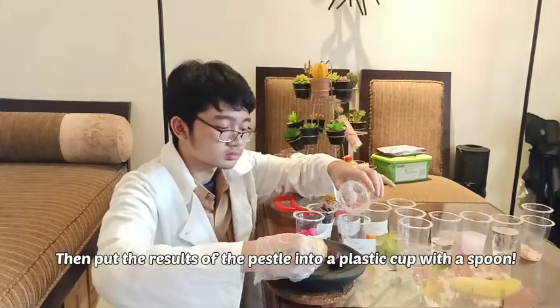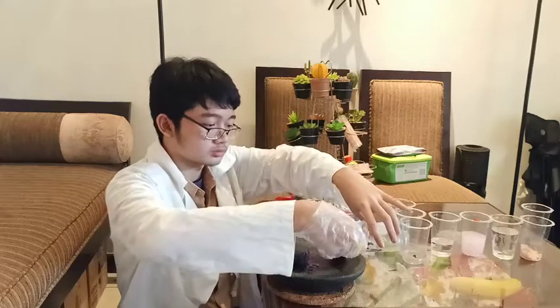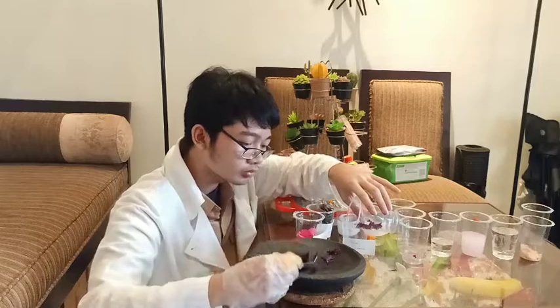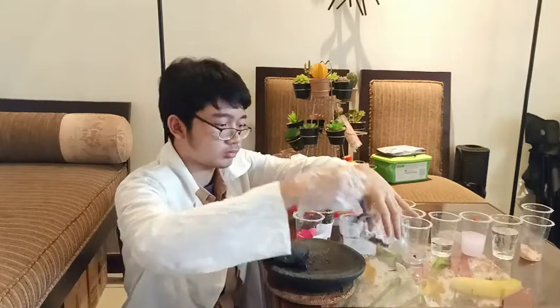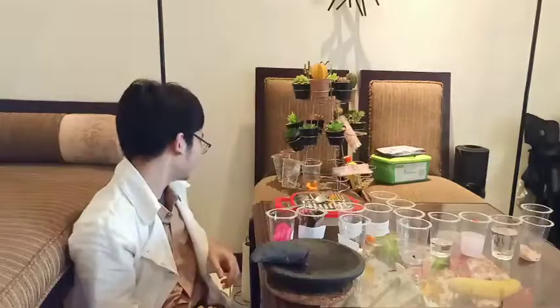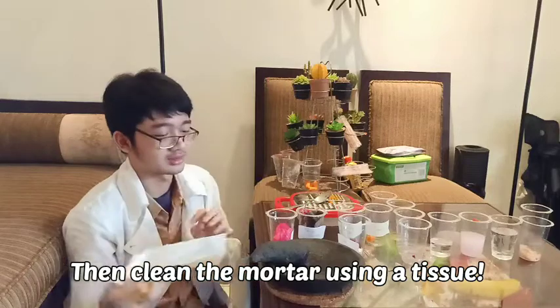Then put the result of the pestle into a plastic cup with a spoon. Then clean the mortar using a tissue.